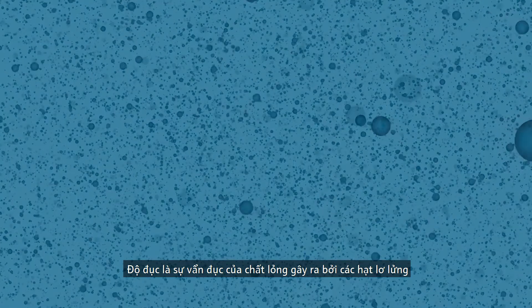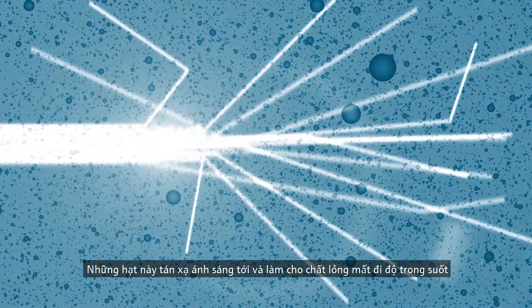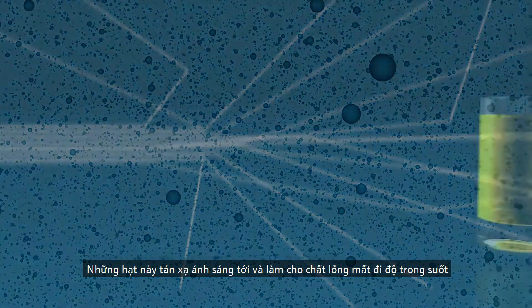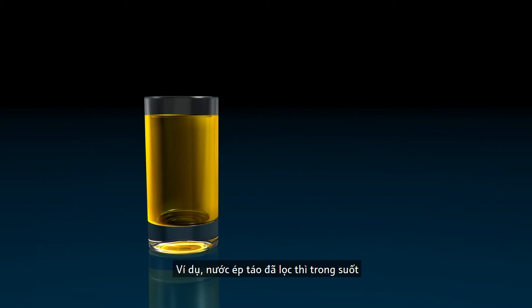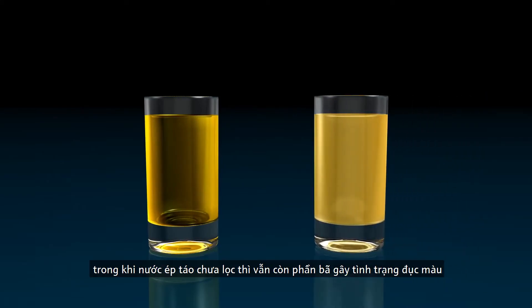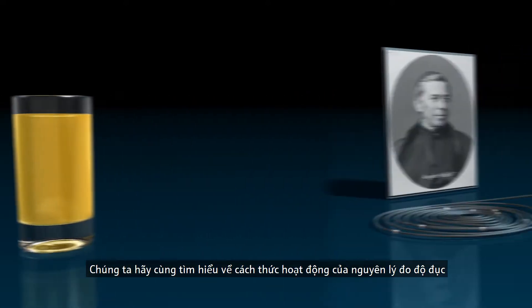Turbidity is the cloudiness of a liquid caused by suspended particles. These particles scatter the incident light and the liquid loses its transparency. Filtered apple juice, for example, is transparent, while unfiltered apple juice that still contains fruit pulp appears turbid.